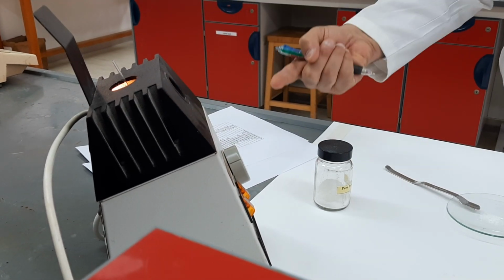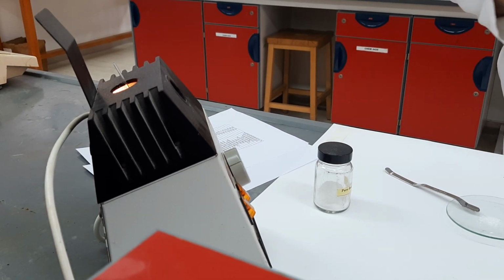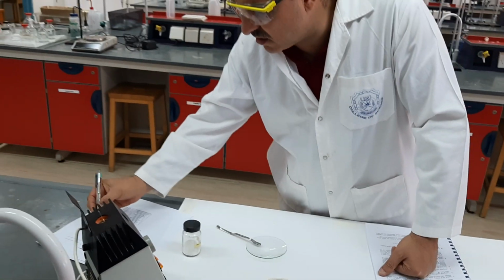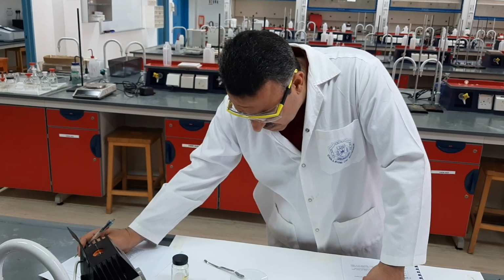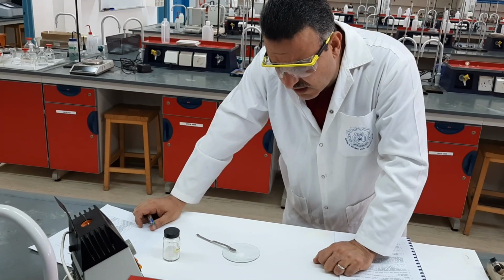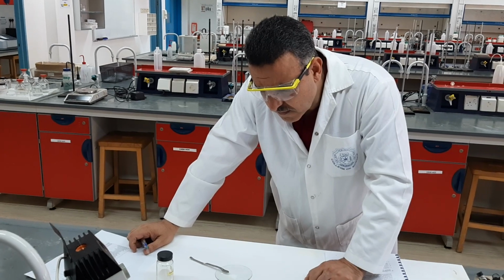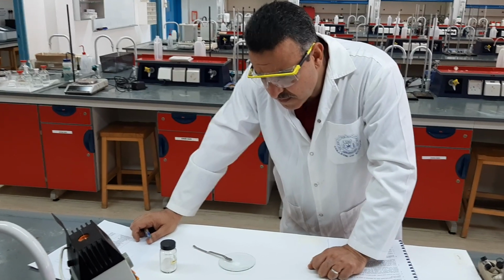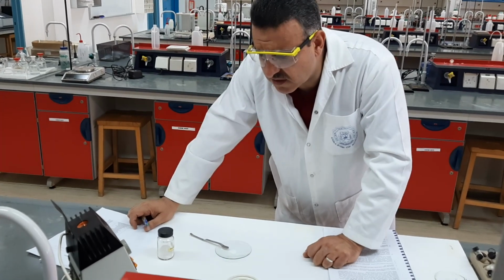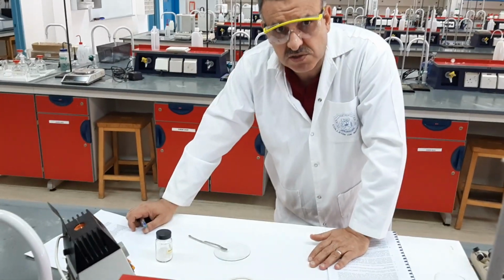You will find the report, as it's supposed to be downloaded, in the Moodle. For example, in this case, I record the melting point. Once it has melted, I just have to wait and see. We can take a break until it melts fully, and then we can record further. Just stop it.